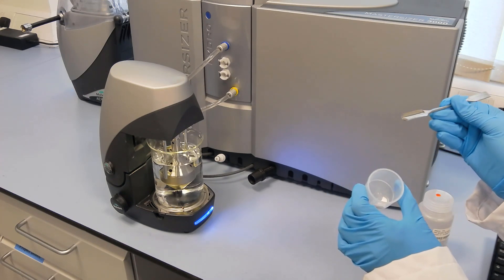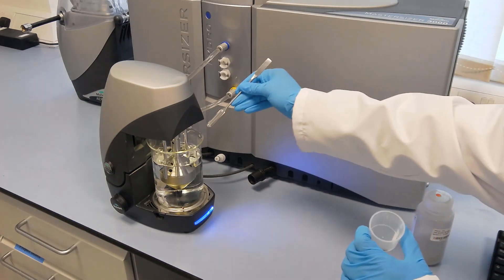This can then be taken on the spatula and gradually added to the dispersant by watching the obscuration.